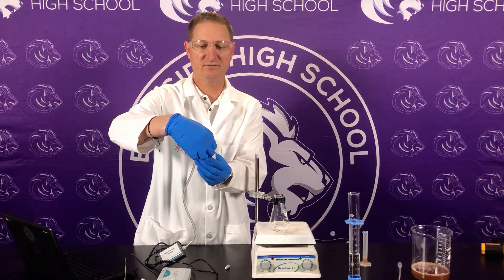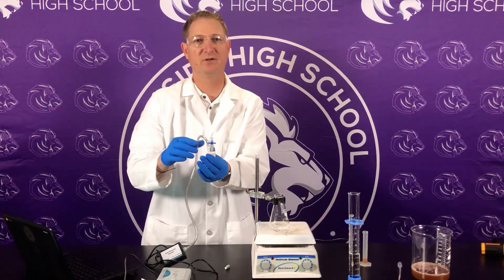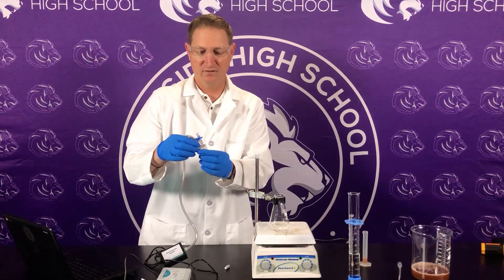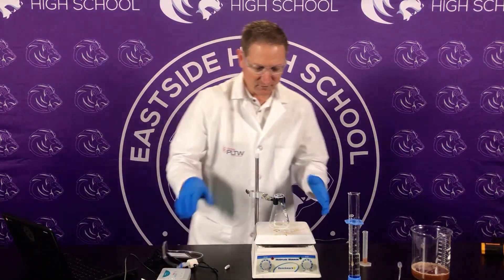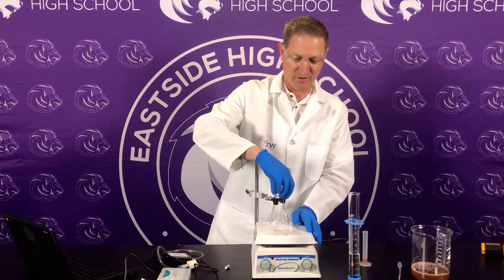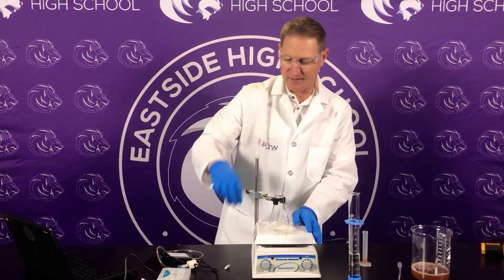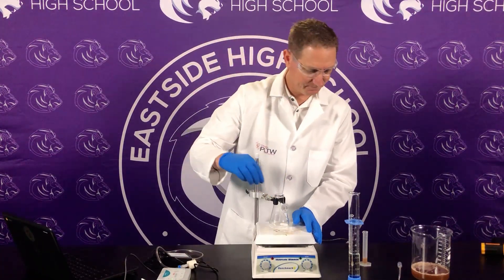We're going to make sure that it's closed so we don't lose any of the pressure, because we're going to check the pressure that builds up as this oxygen gas is released. We're going to make sure that these are secured. Here's my setup — I have a stir plate and a 125 milliliter Erlenmeyer flask. I'm going to go ahead and put my stir bar in.